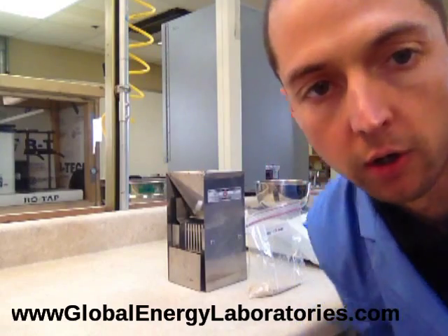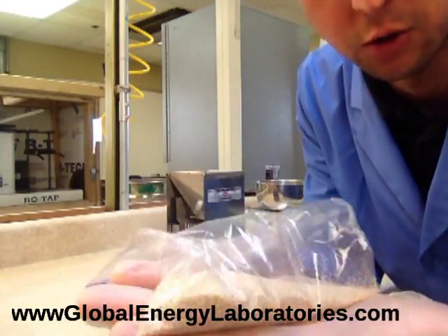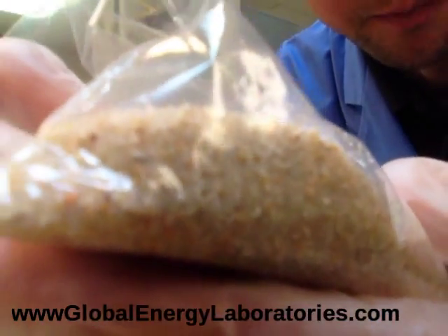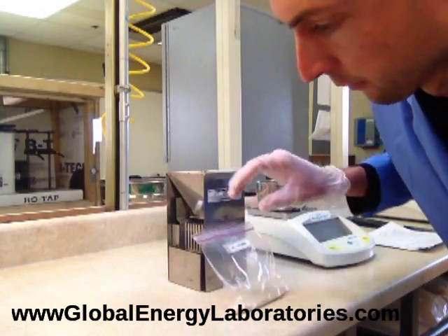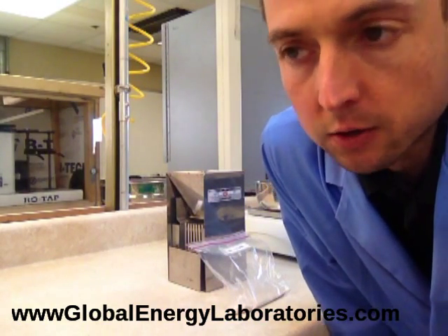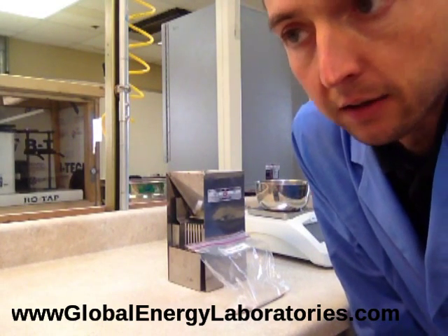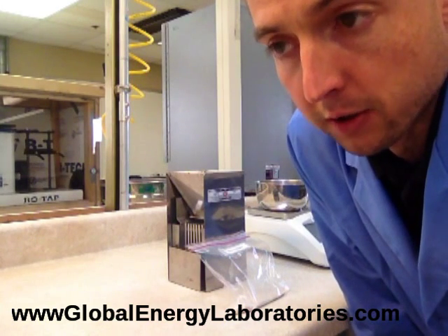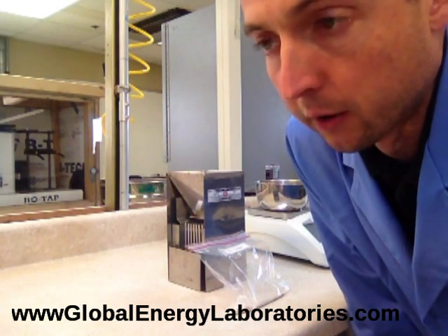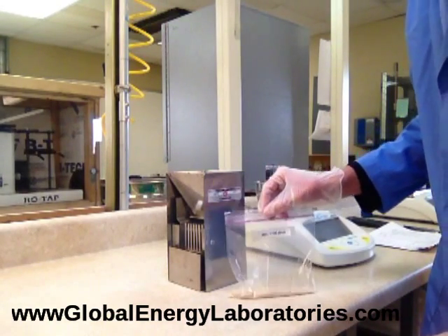Hey, Brandon DeShaw here, Global Energy Laboratories. Today we're going to talk about how to do crush testing on frac sand samples. I'm going to walk you through all the steps involved with performing a crush test. In this case we're going to crush some 2040 sized sand at 4,000 PSI — so we call it a 4k test on 2040 sized sand.